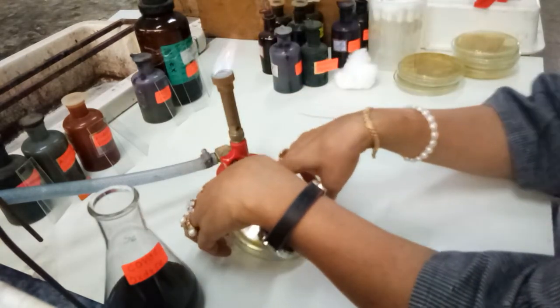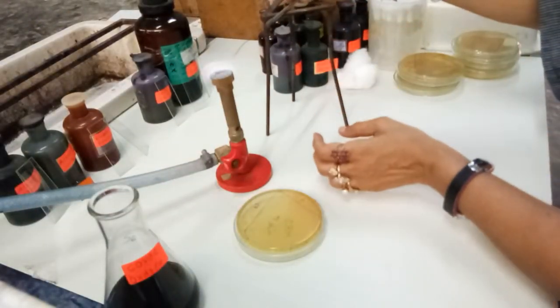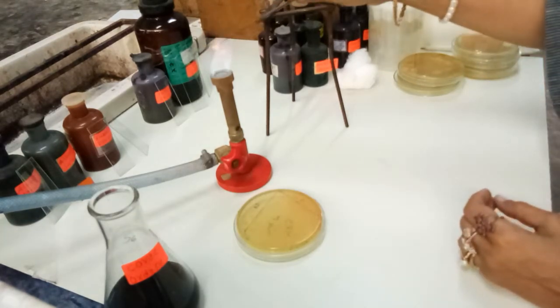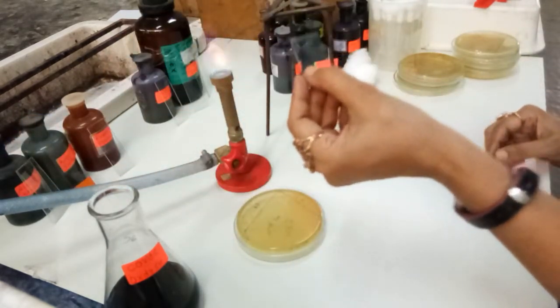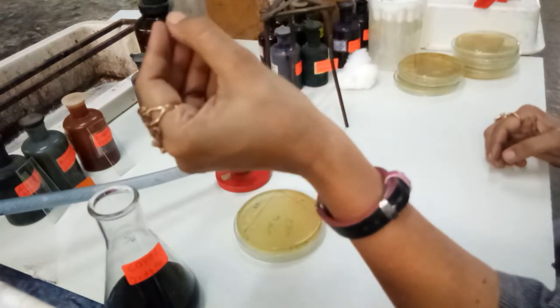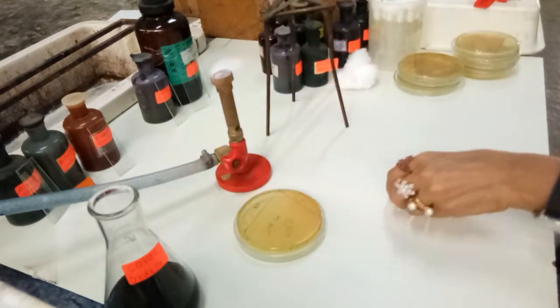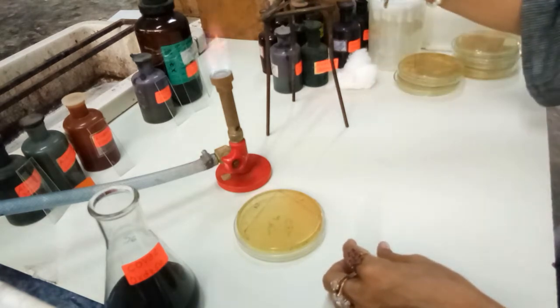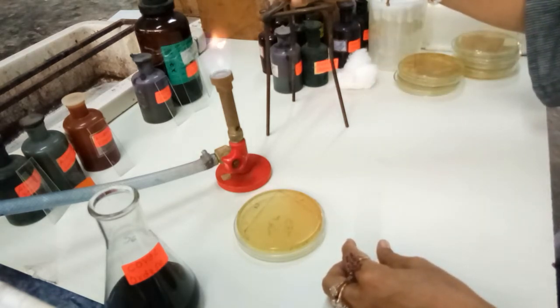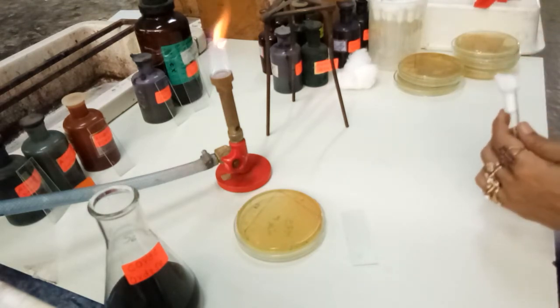Now here, the very first thing we will do will be, we will sterilize our nichrome wire properly, and then we will take out a little material from the colony and keep it on the center of the slide, and then we will add one drop of H2O2, and we will try to see whether catalase enzyme is positive or not, whether we are getting the bubbles or not. So that is our lookout now, and that we are going to do now. And by the time we will also make the suspension of lactobacillus.